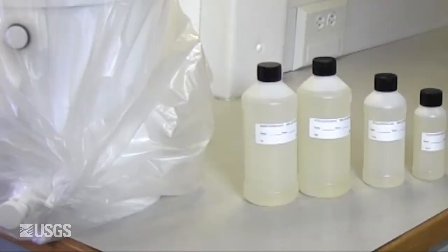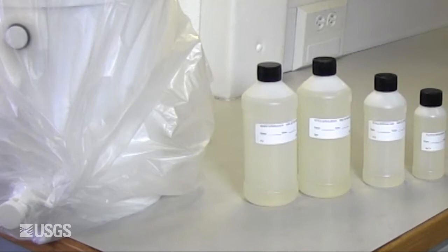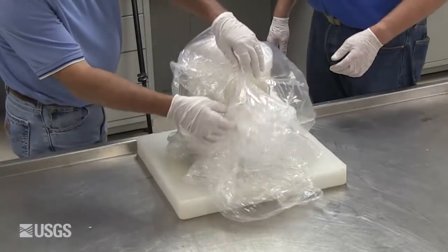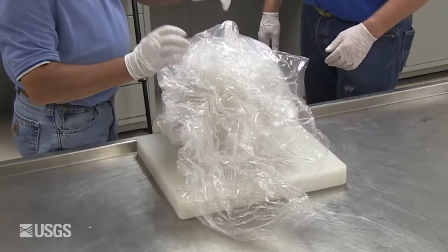Samples should be withdrawn from the churn in order of volume, largest to smallest. Empty the churn after all bottles have been processed.